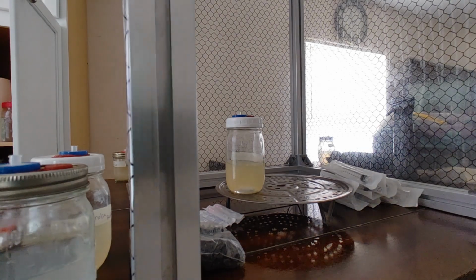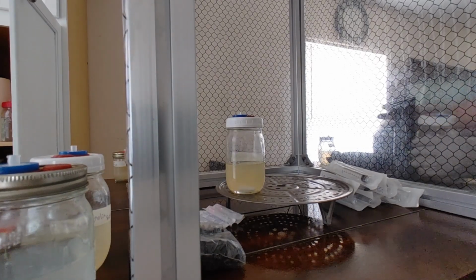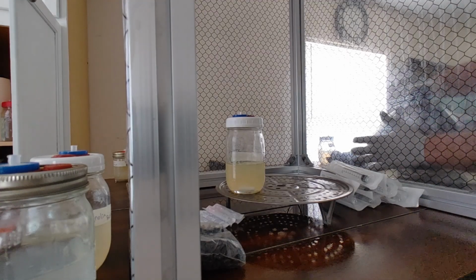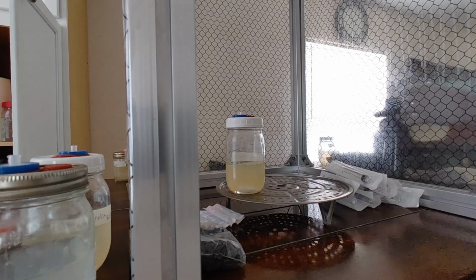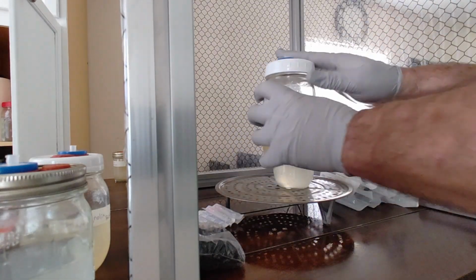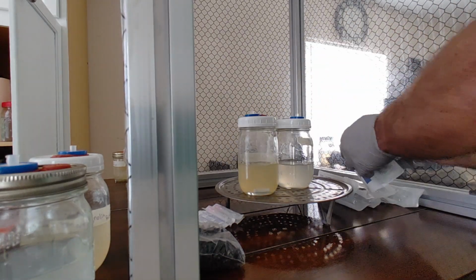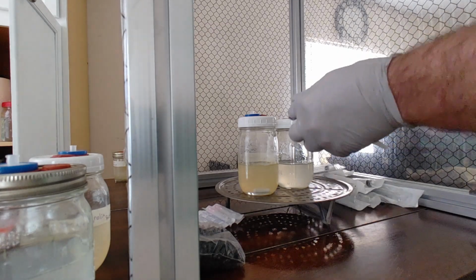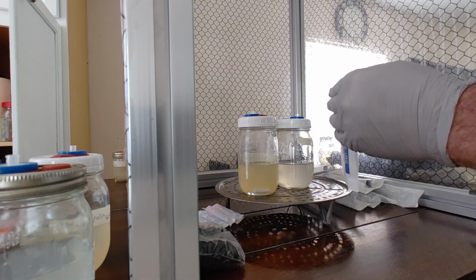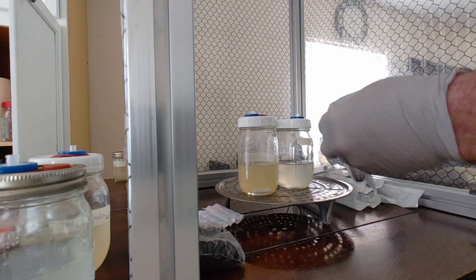And I'm also gonna grab a second one, and I'm gonna spray it down too. Maybe you can see through, I'm not sure. We're gonna get it all nice and cleaned up, making a special effort to get those injection ports good. Then what we're gonna do is grab a syringe. If I can peel this bad boy. There we go.